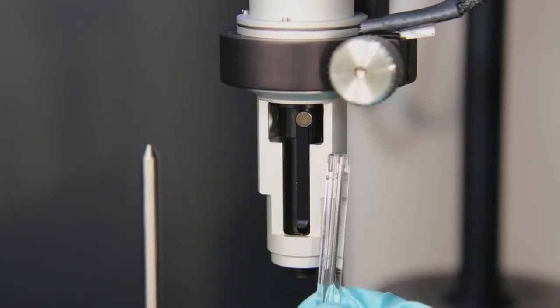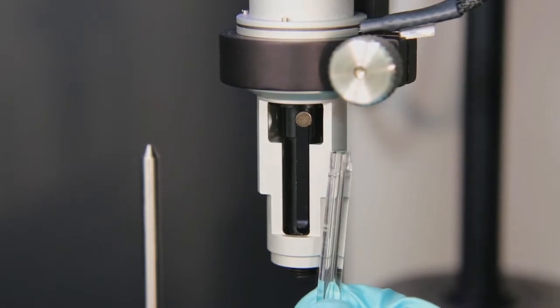To install a syringe, we need to align the syringe glass to the pipette assembly. This can be done in two ways.